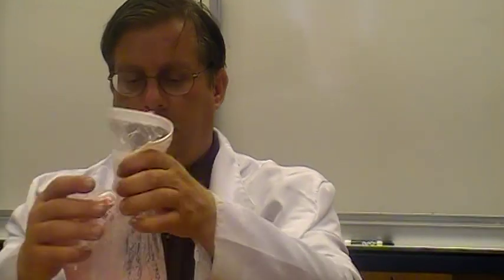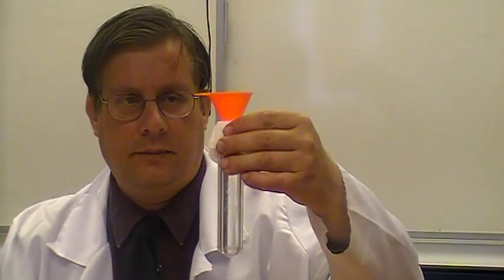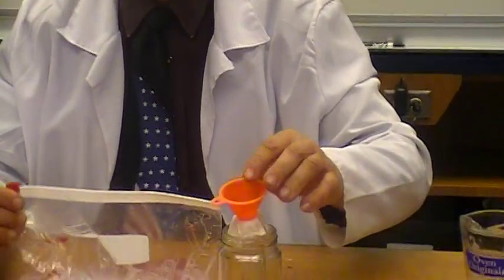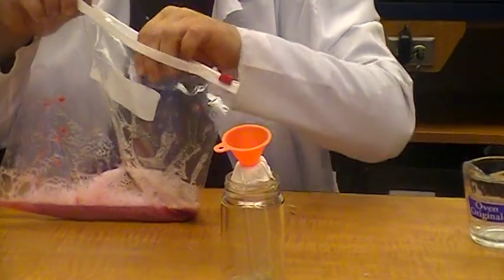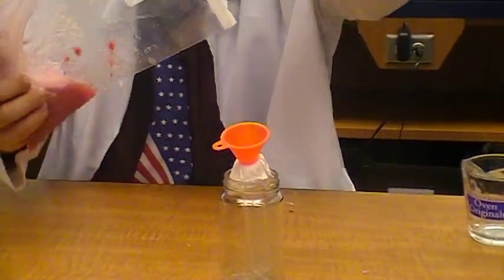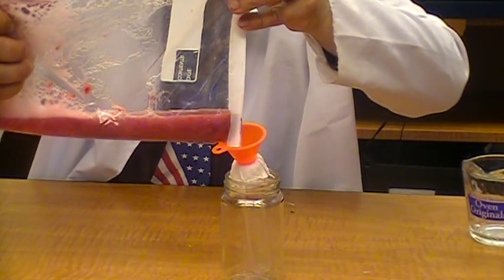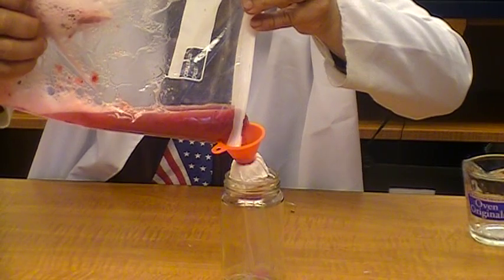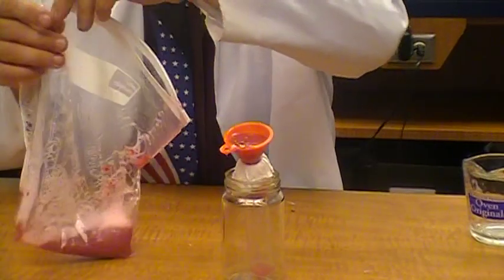Okay. We still can't see the DNA in here. And so what we need to do to get to the DNA is we need to use our test tube for this experiment with some filter paper and a funnel. It's the first time I've tried a funnel for this so I'm hoping it makes the juice filter through a little faster. And I'm just going to slowly pour the combination strawberry soup and lysis solution into here.